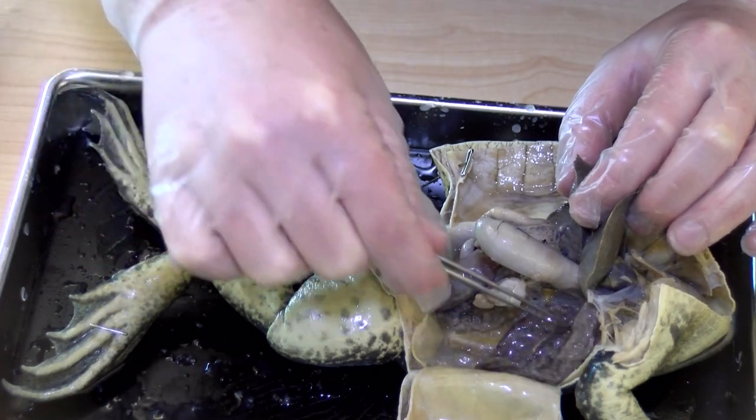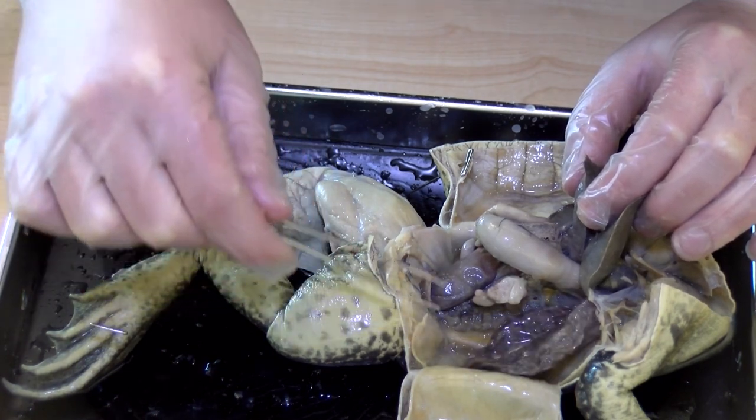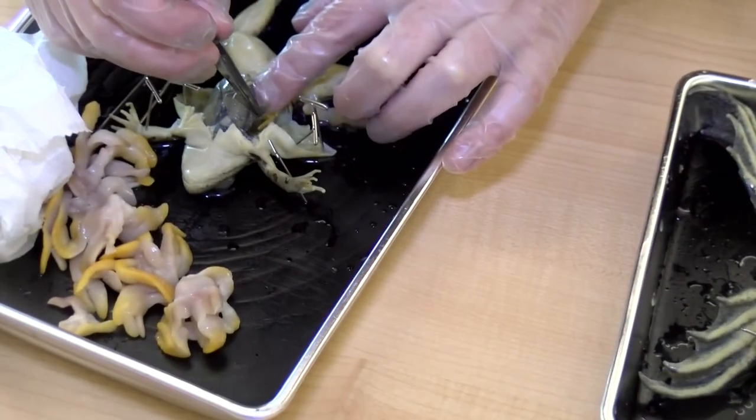What's that? That's a lung — right there. Isn't that cool? Are you going to blow up his lungs? They seem so much bigger than what I remember. This little dude's lung is right there.